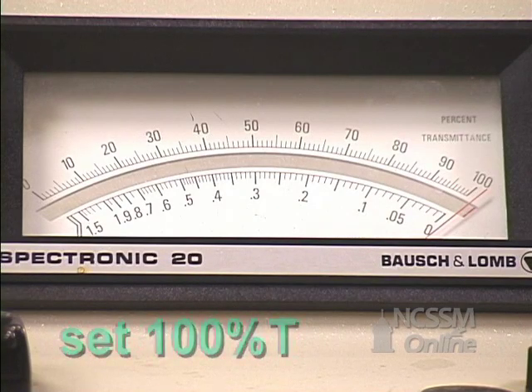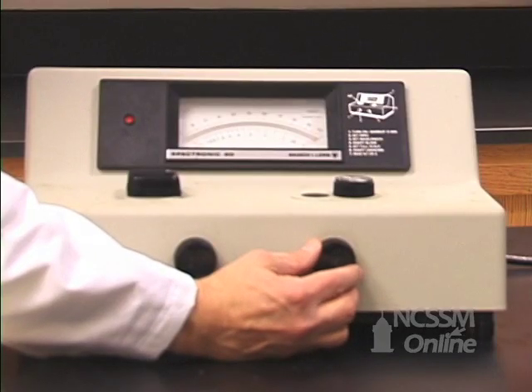We will then measure the percent T of each of the solutions and calculate the absorbance from the percent T.